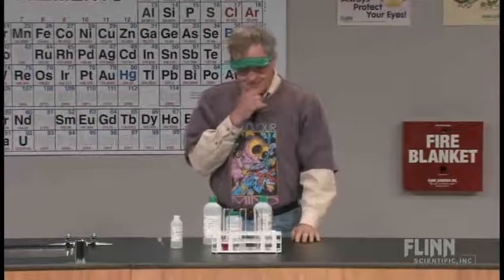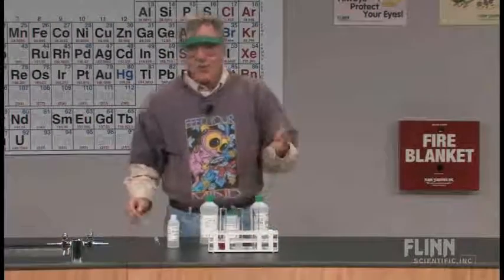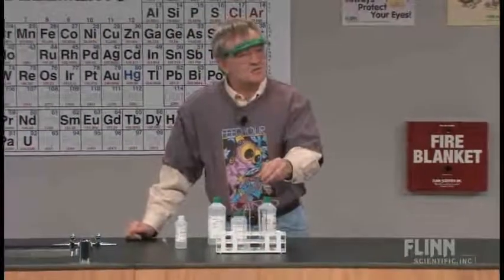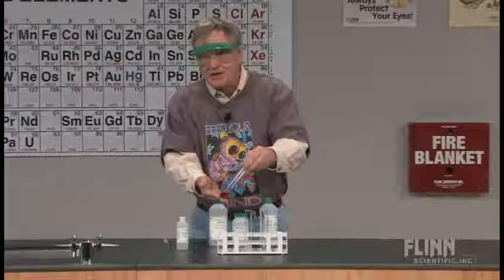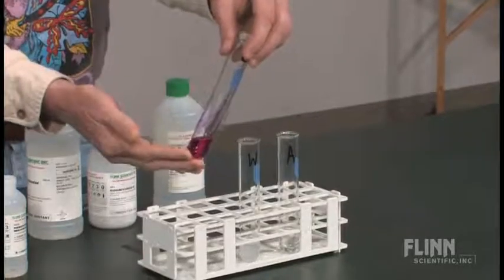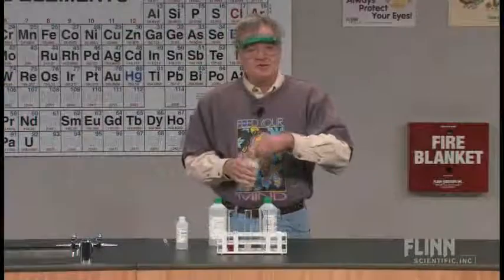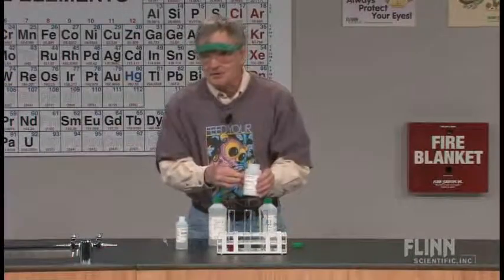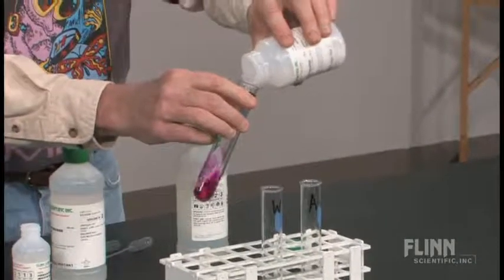Now I want to go a little bit farther and ask another question: what's going to happen if I put more base in there? That's what students want to see — it looks really cool like this, but how about if I put some more in? Let's make it bigger. So I'm going to take the next step and put sodium hydroxide solid in — I'm going to shake in a few pellets and really push beyond.